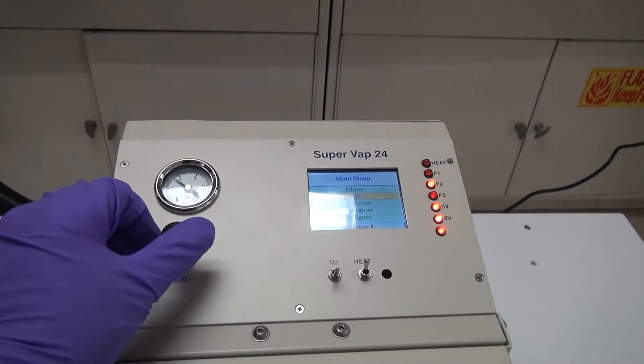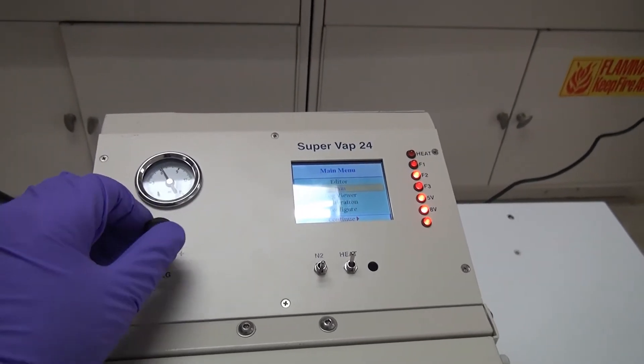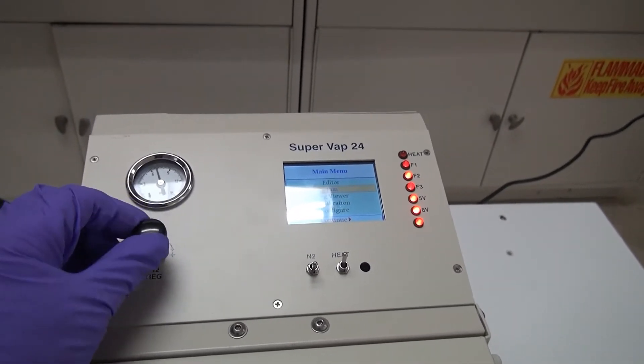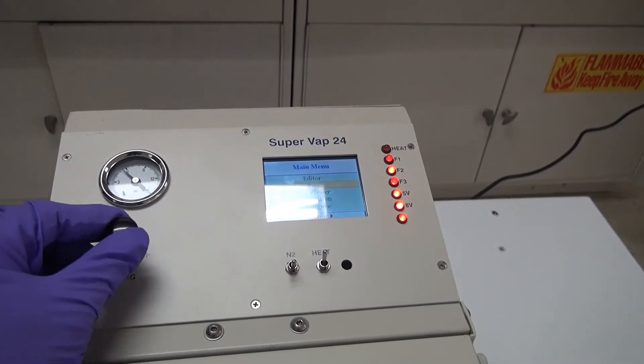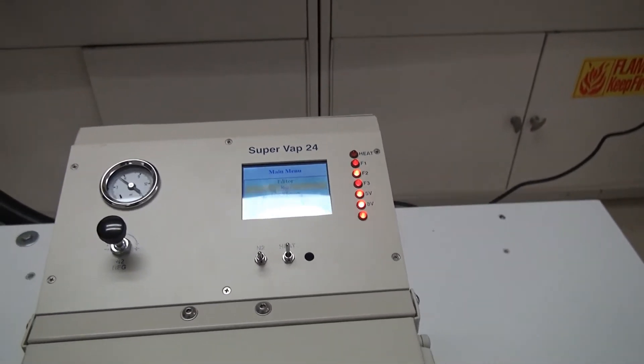a nitrogen setting that you can go up to 15. We run at around five, we find is ideal for this.